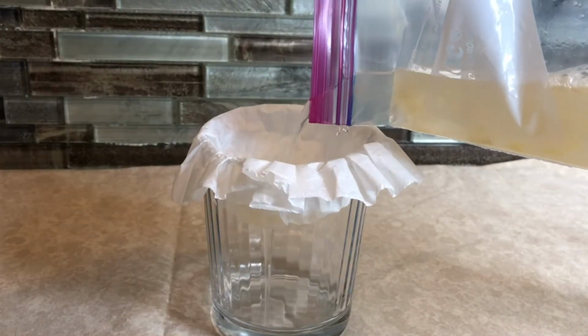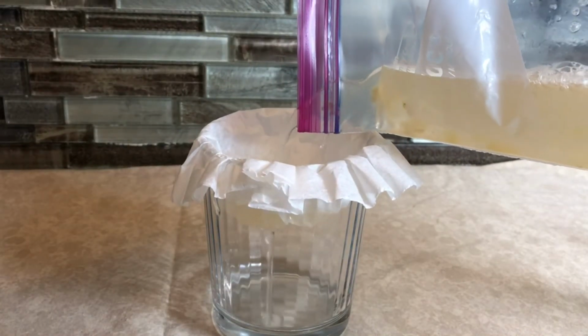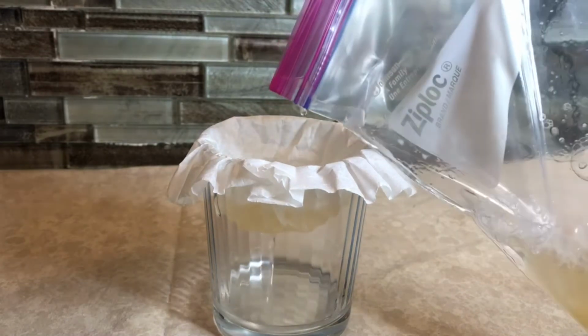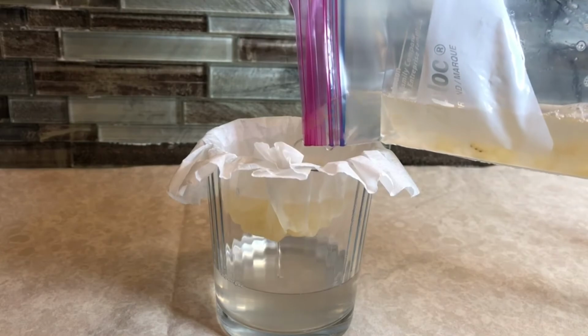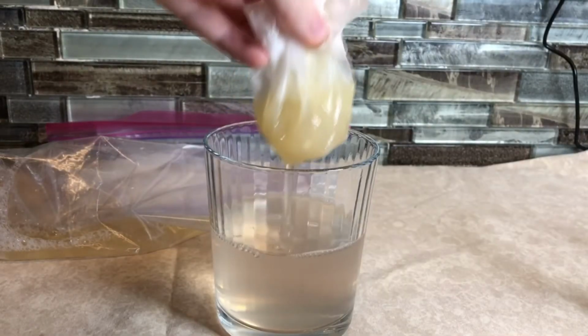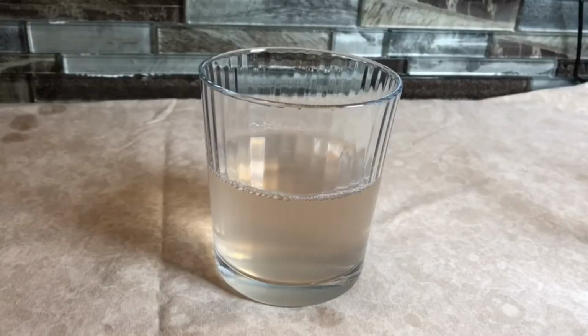Open the bag and gradually pour the bag's contents onto the filter. Do not do it all at once, otherwise the cup will overflow because it cannot filter fast enough. Wait for the contents to drain fully. This may take about 8 to 10 minutes. After all the liquid is filtered through, throw out the contents left on the filter as they are no longer needed. You can now take the rubbing alcohol out of the fridge.